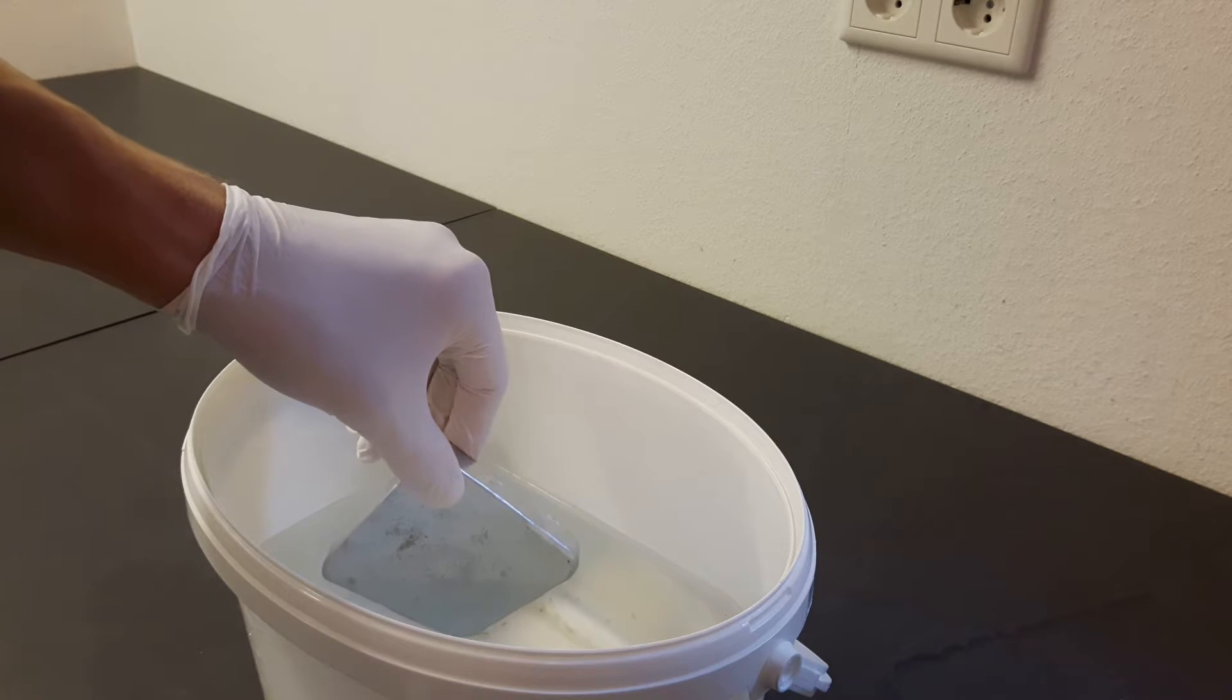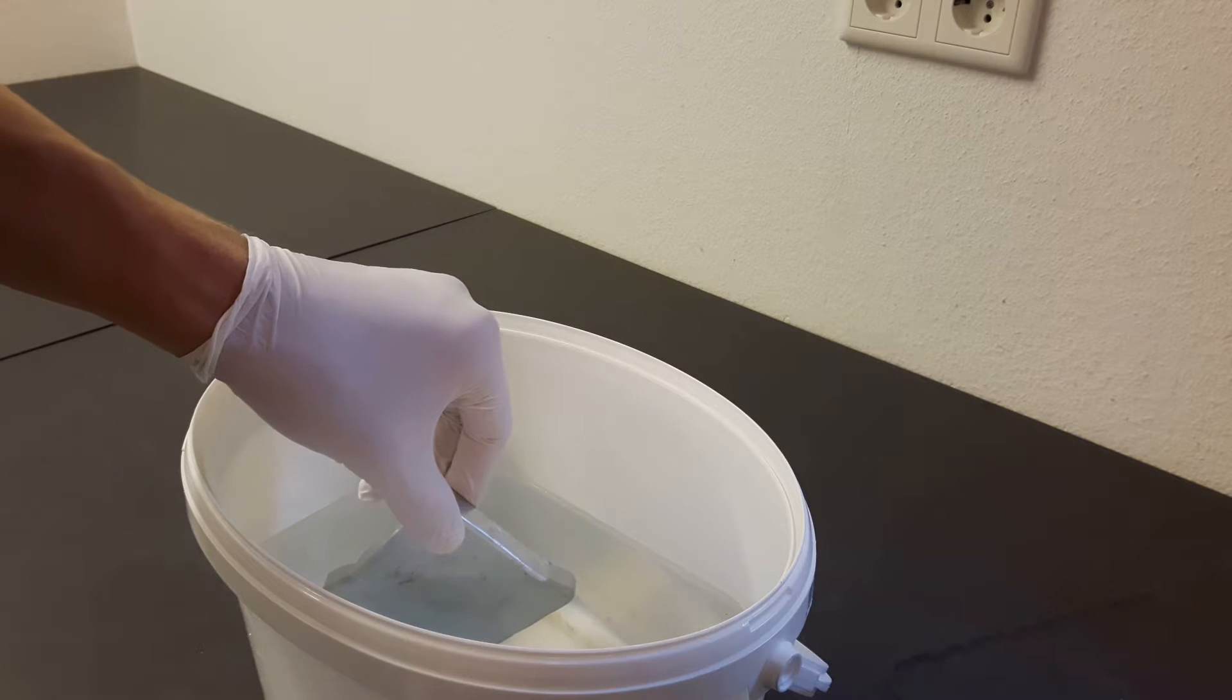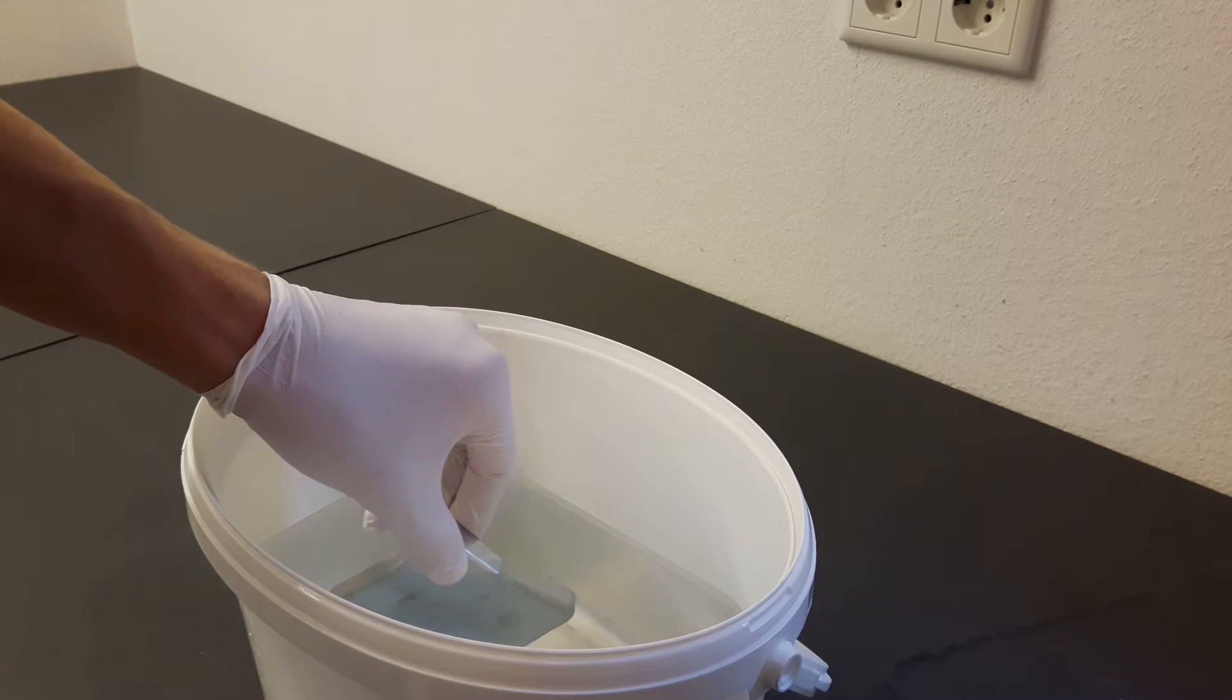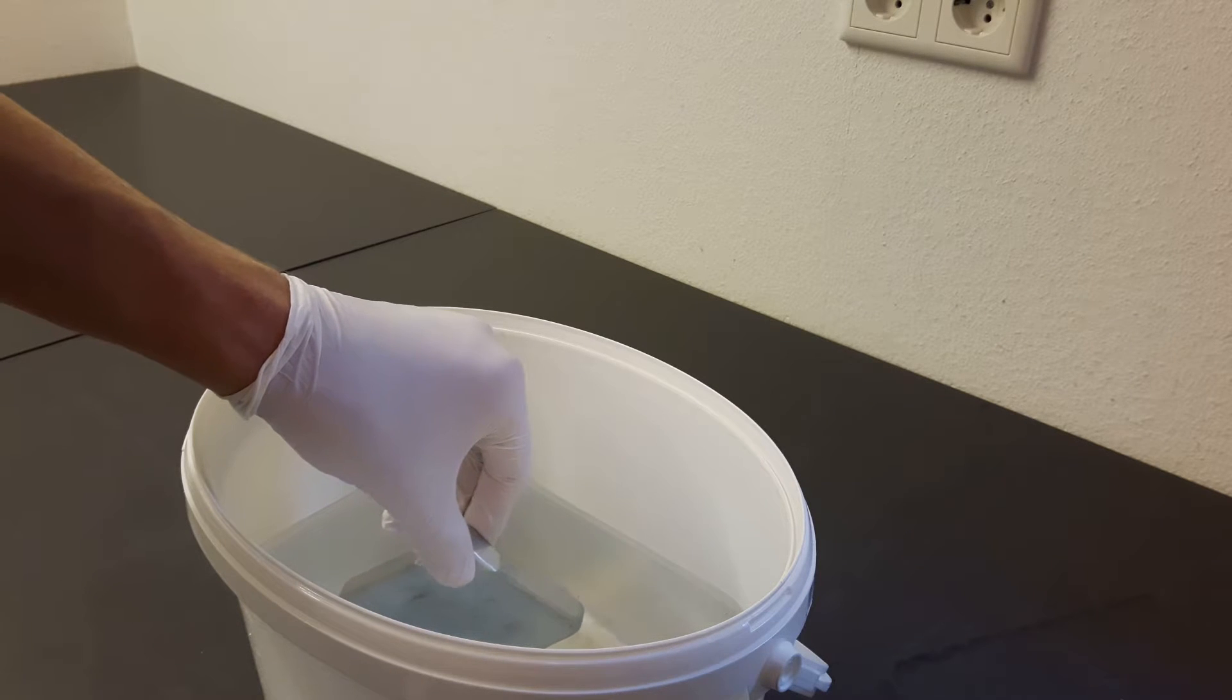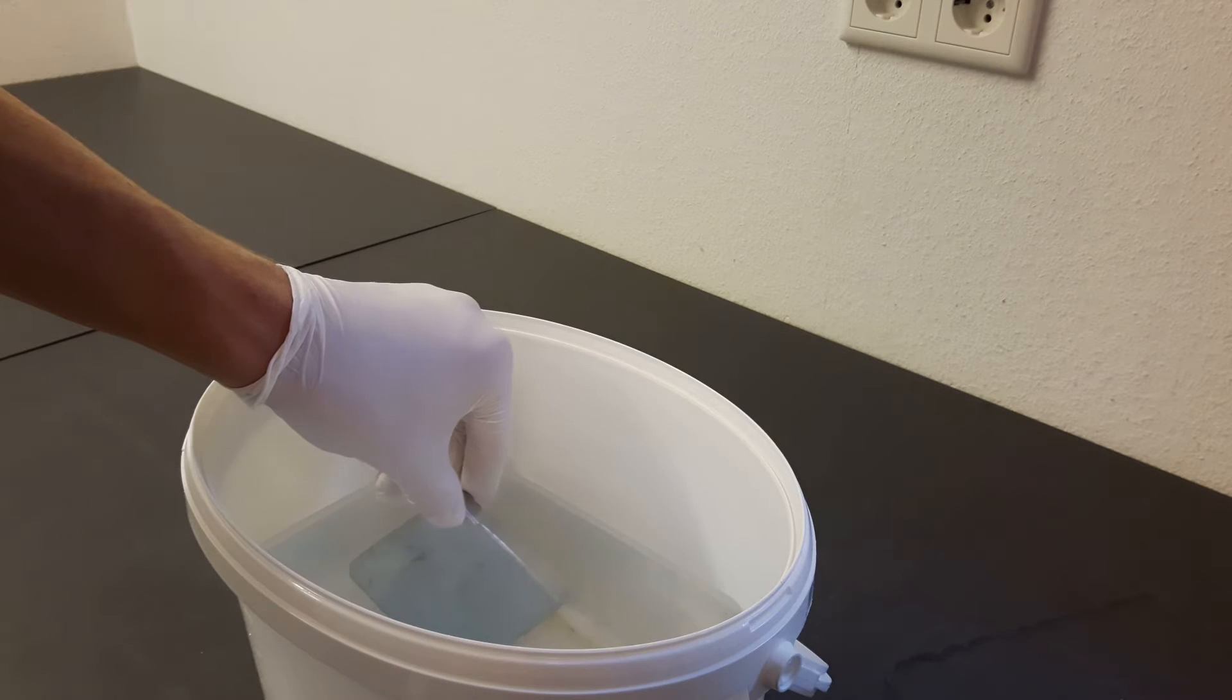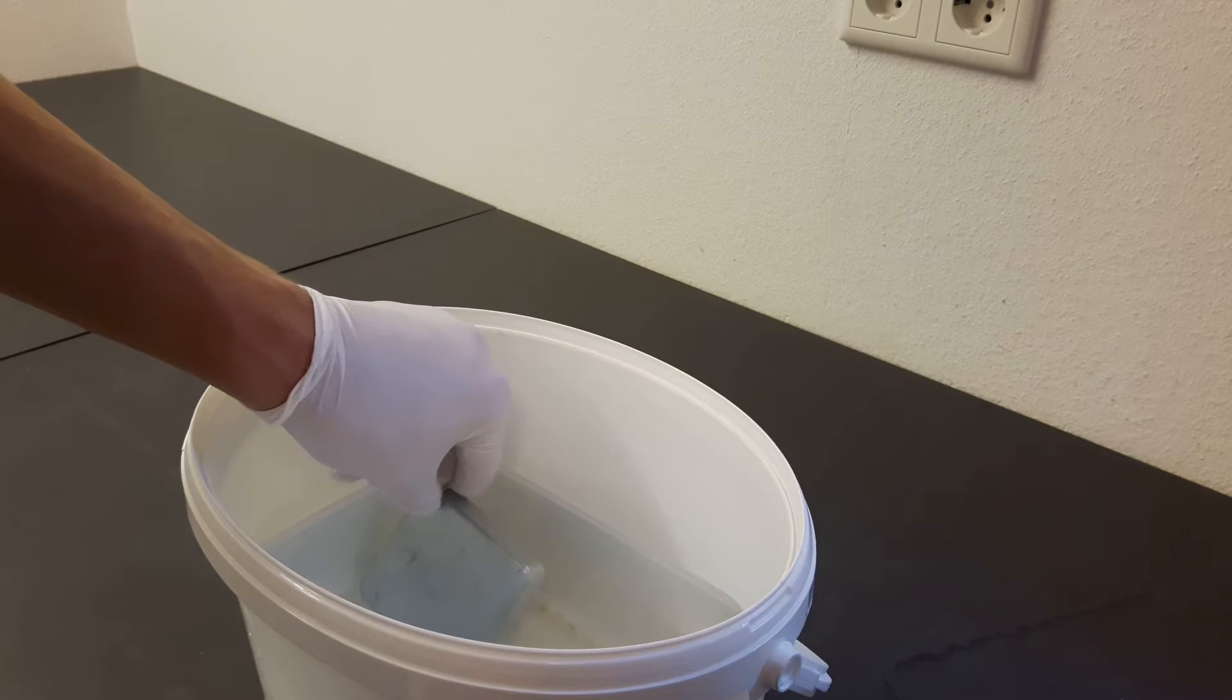If there is any lead in the zinc ingot, the density would be higher than 7.1 grams per cubic centimeter. Additionally, if there is lead in it, which I hope there isn't, I have to purify it before I can use it in chemical reactions.